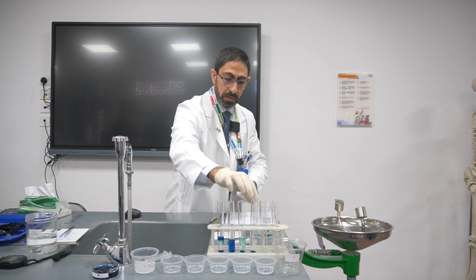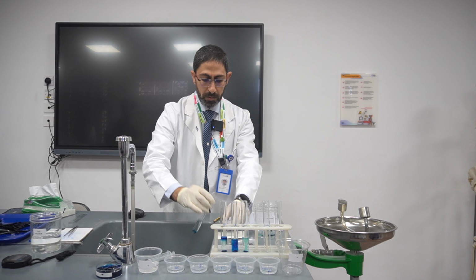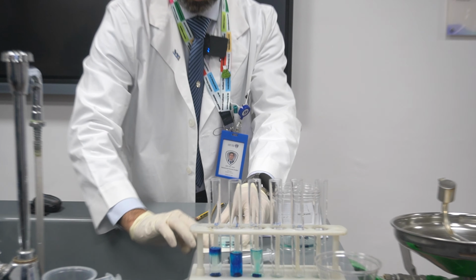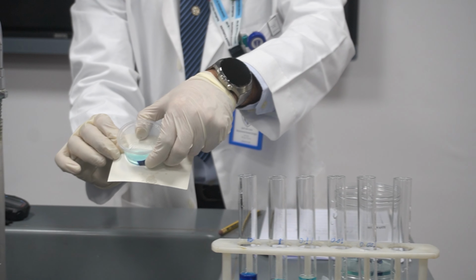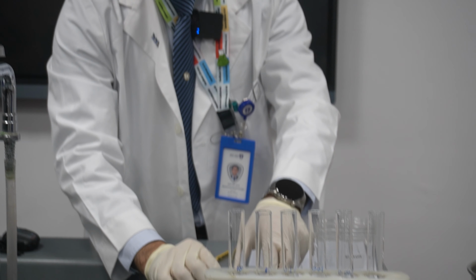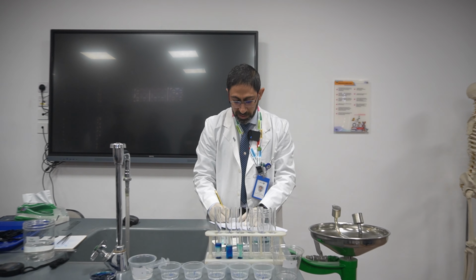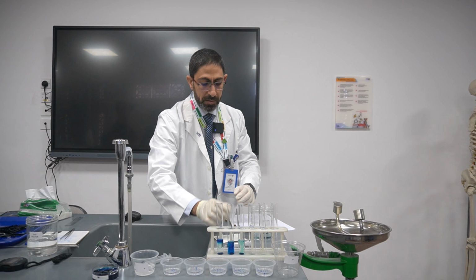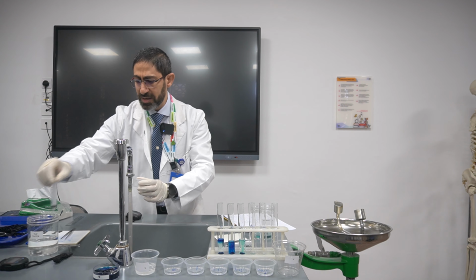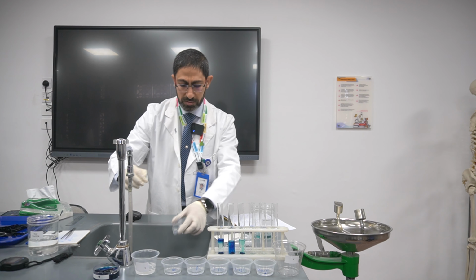Then I will go for the next concentration, which is 0.01. What about the color intensity here? If you have a look here, it is more intense. Yes. Exactly. So I will give it here triple plus according to the scale we are using. Then I will discard it in the waste. Clean it. It is not a must, but just for better results.